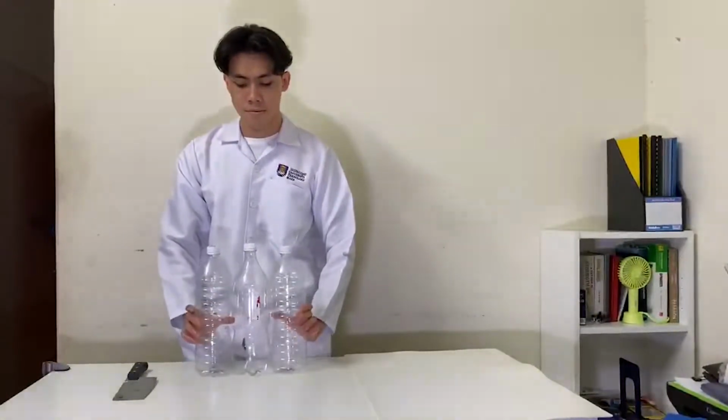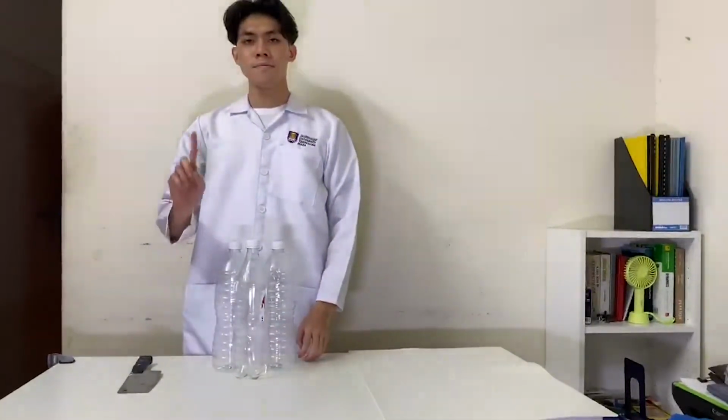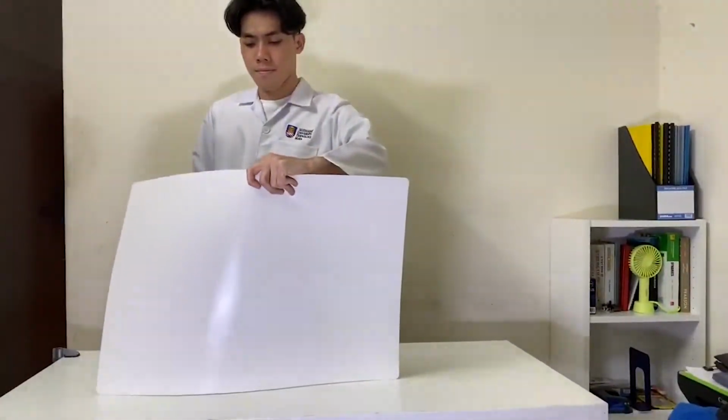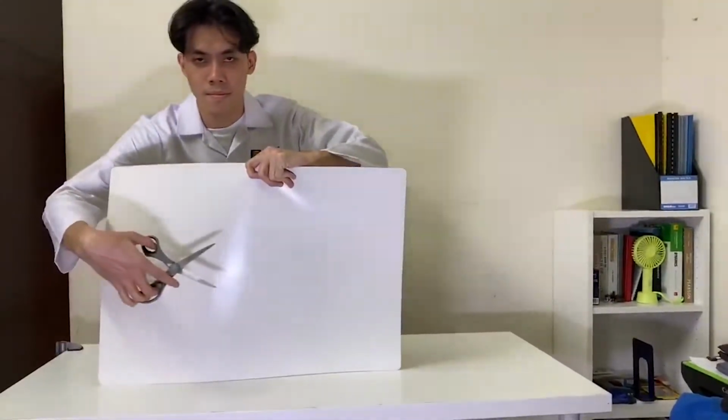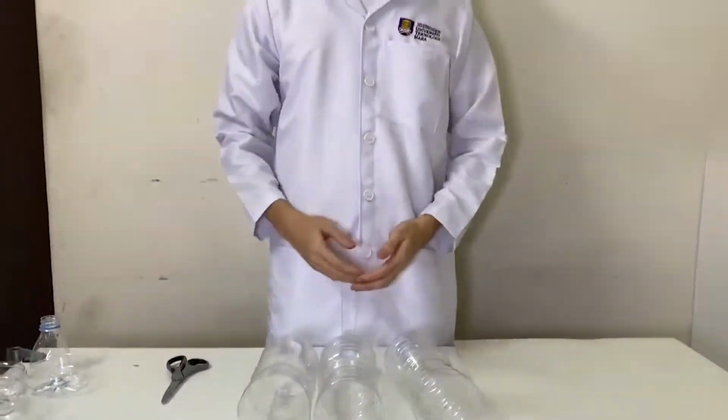First, we took 3 water bottles and cut them. For safety purposes, please don't use a kitchen knife. Use a proper scissor to cut it. And this is the result, the bottle.